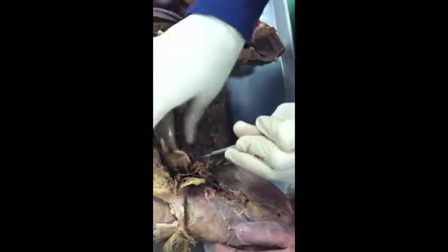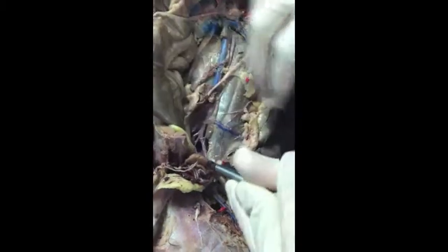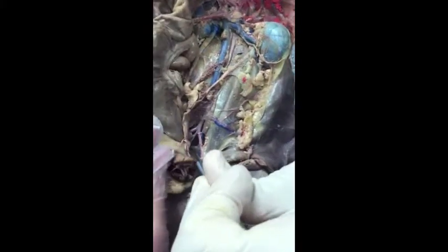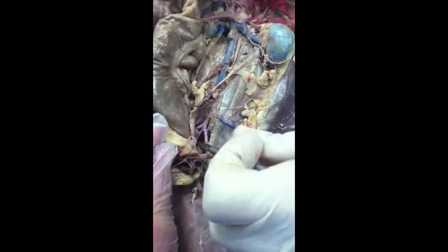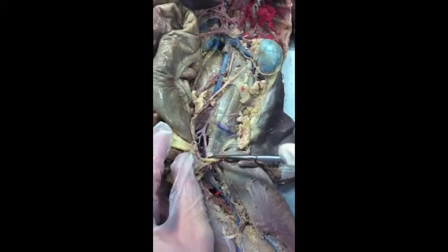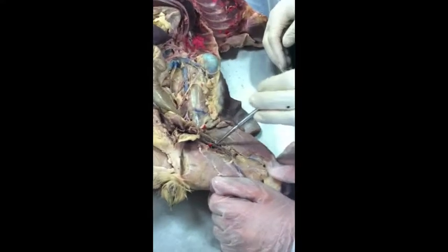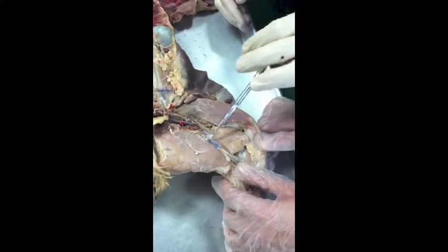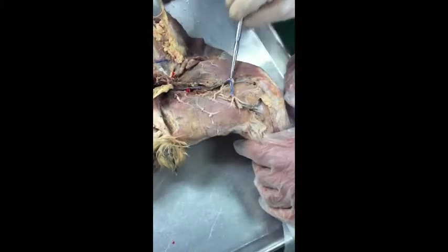How about the little ones going to the tail? What are they called? Caudal, exactly. Those you can kind of see right there if I'm moving the artery and vein. They're kind of moving. They're way down there. Just remember, they're very deep, heading to the tail. As we keep going, what's in the thigh? Femoral. And around the bend of the knee there's a branch point here. What's this one called now? Greater saphenous. Exactly. So that's your vessels.